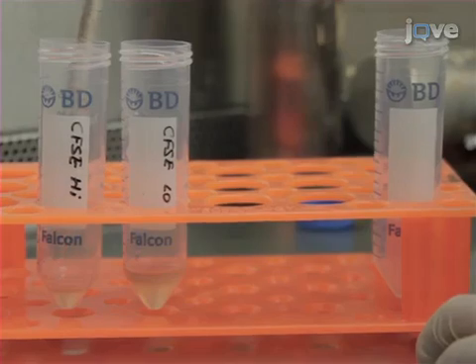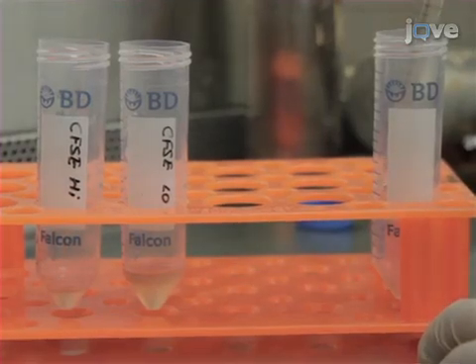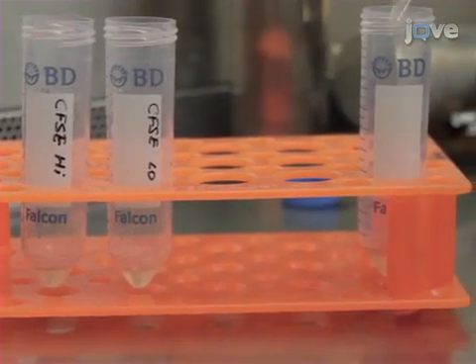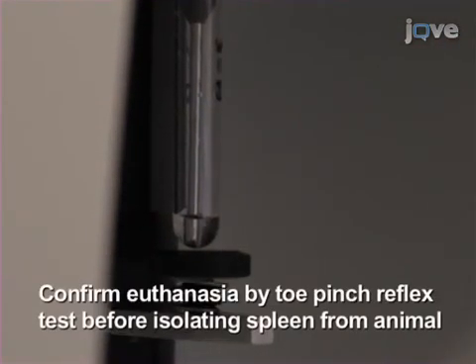Mix 2.5 times 10 to the 6th CFSE high cells with 2.5 times 10 to the 6th CFSE low cells in PBS. Then analyze the splenocytes by flow cytometry for CFSE expression 16 hours after adoptive transfer into the mouse of interest.